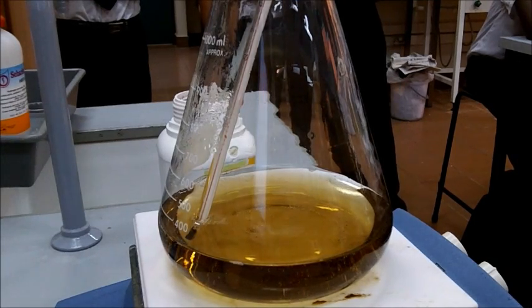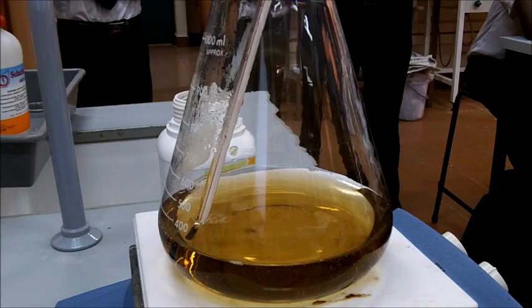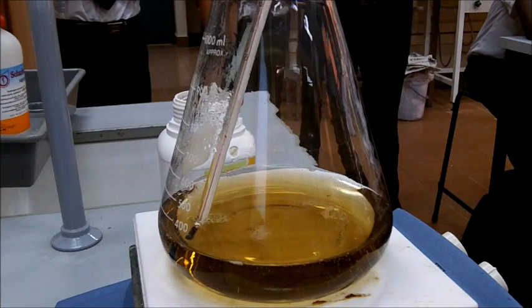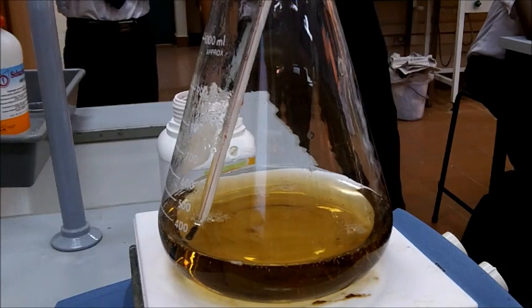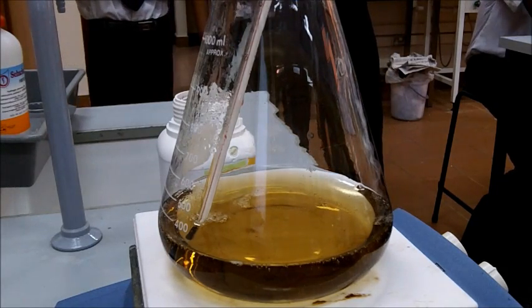So the peroxide is starting to be decomposed. The color is... I don't know quite how to describe that. Olive green or something? Definitely not pink.